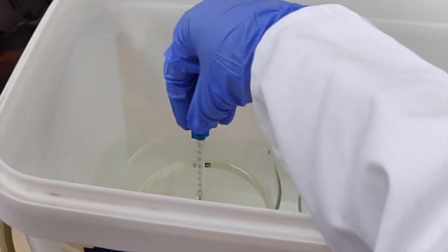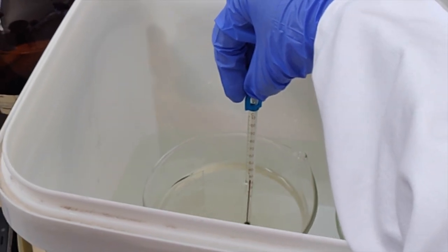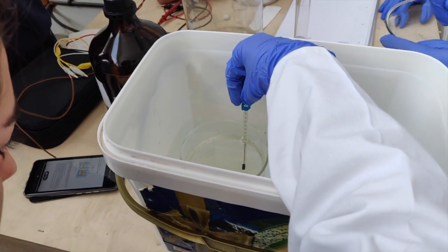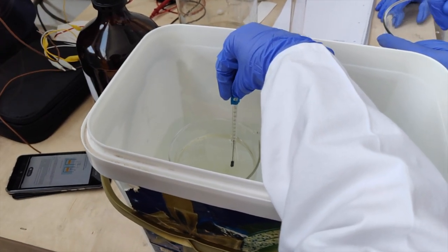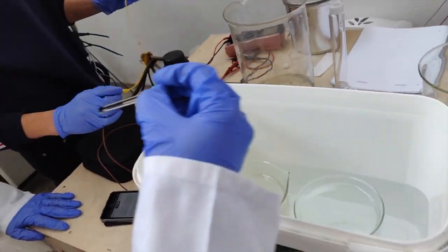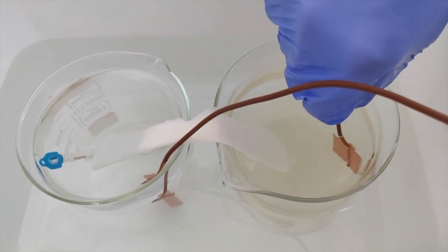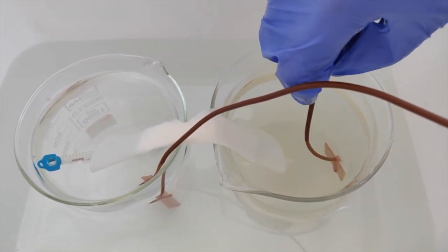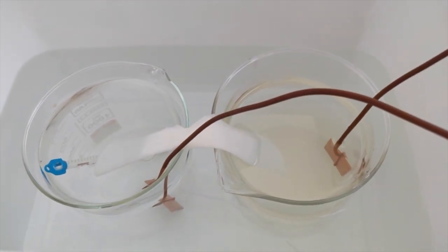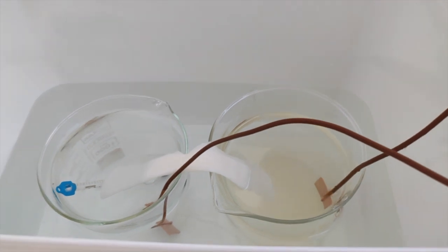Resistance polarization has the biggest effect of all types of polarization. During experiment 2, the concentration of the agitated solution was doubled when compared to experiment 1, leading to more electrons being released in the solution and increasing the concentration of copper ions in the solution. In turn, this leads to an increased resistance to electron flow, as it would be more difficult for the electrons to travel from the anode to the cathode.